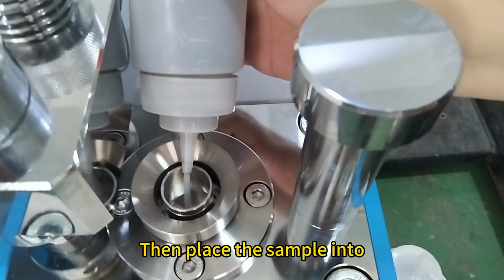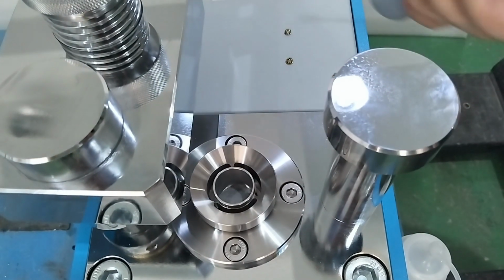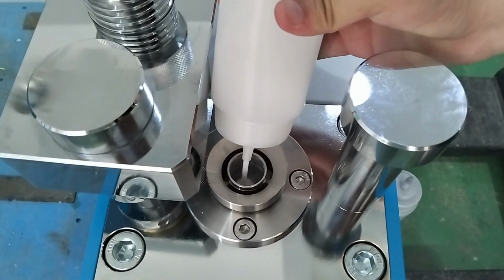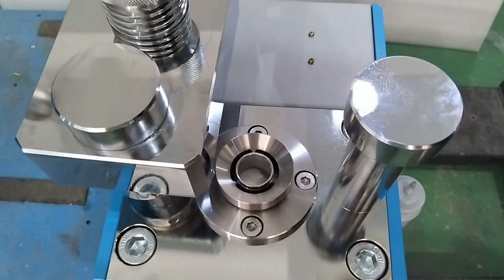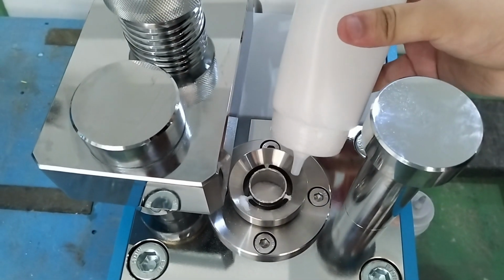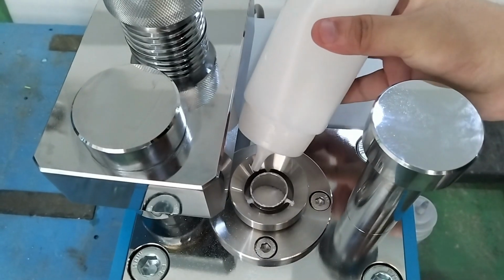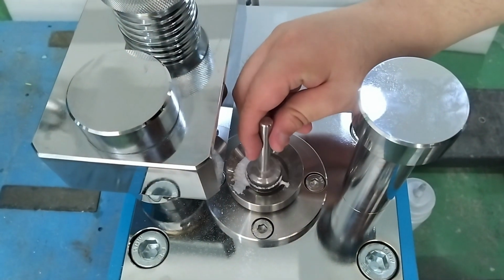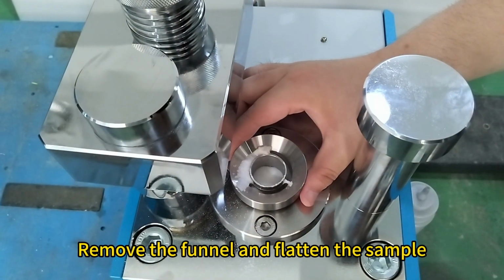Then place the sample into it. Add boric acid again. Remove the funnel and flatten the sample.